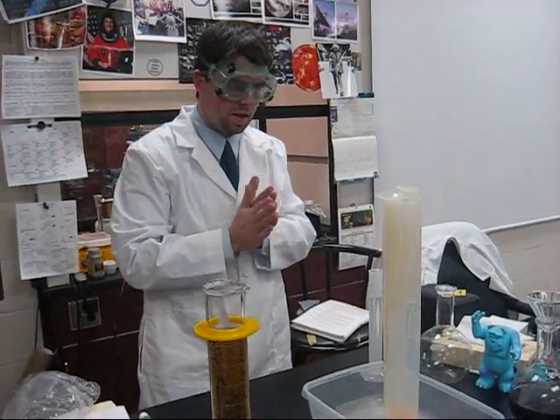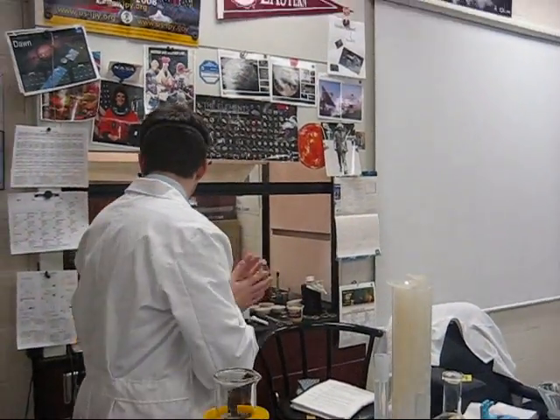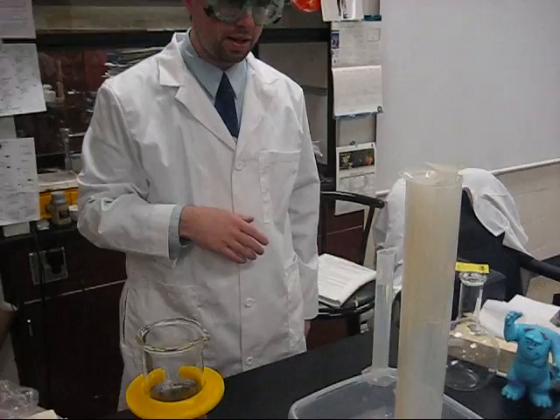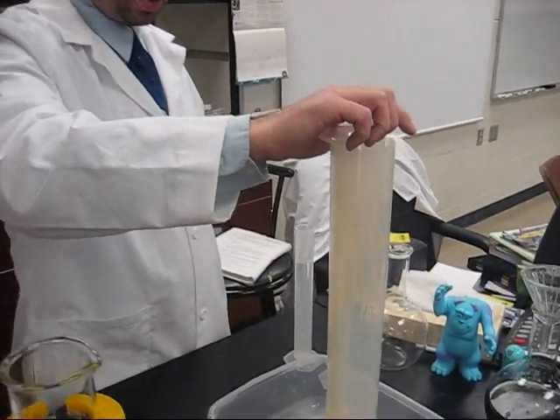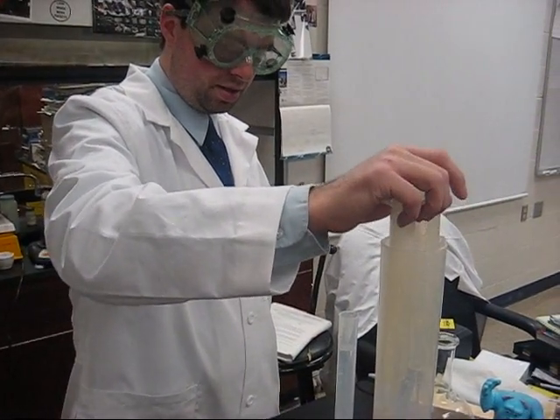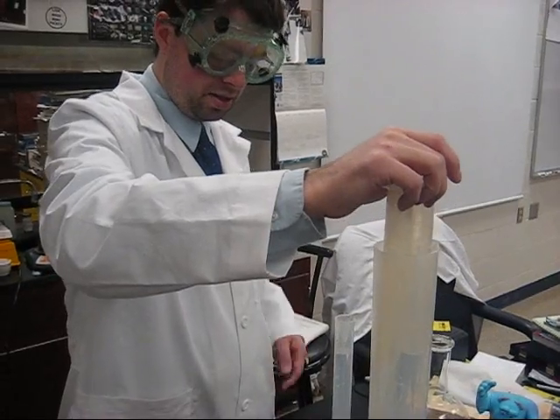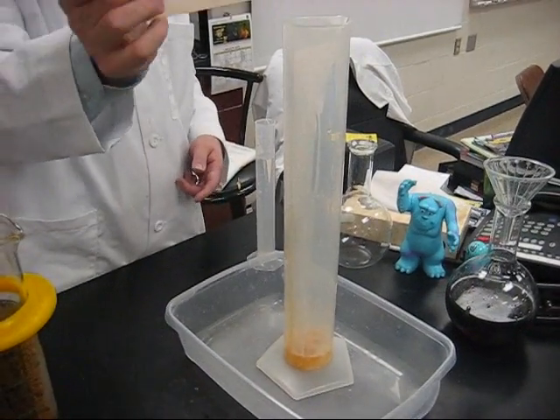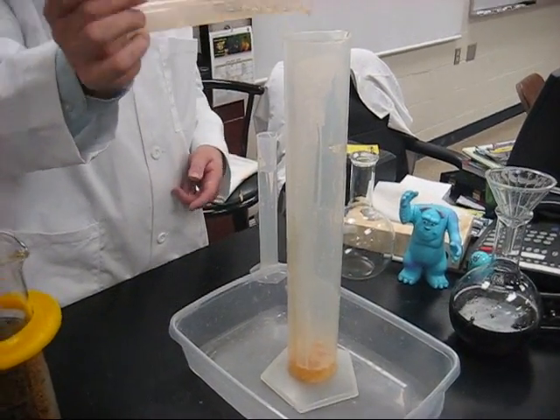For starters, here we have potassium iodide and liquid dish soap, and I've added both of that into the graduated cylinder here — the large graduated cylinder.